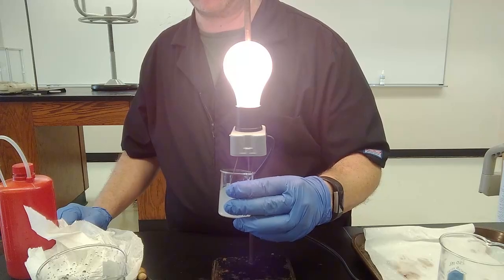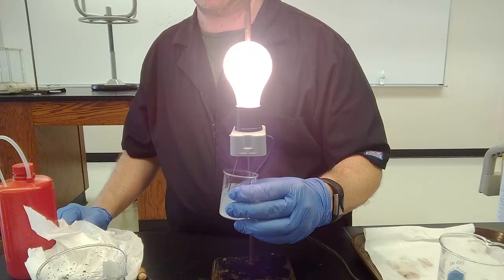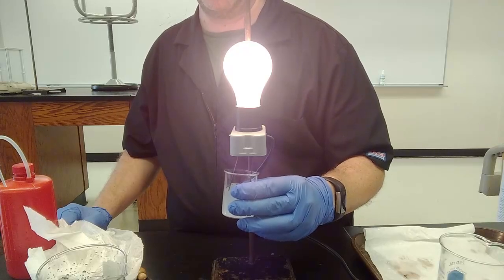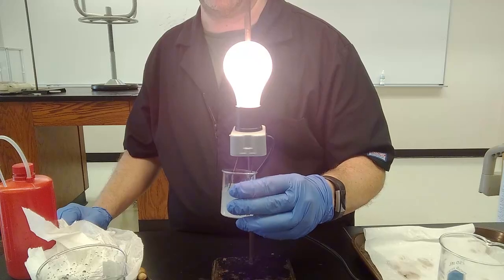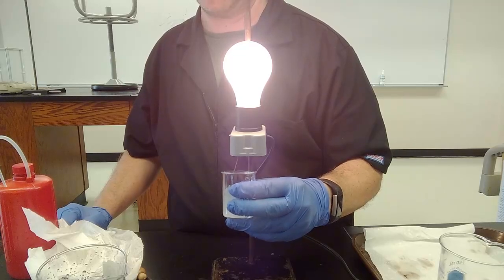Is this metal hydroxide ionic or molecular? Is it an acid, a base, a salt, or none? Does it give us H plus in solution? Does it give us OH minus in solution? Does it give us neither of those but still ions in solution? That's the definition of a salt. Or is it just a molecule that happens to dissolve in water, like sugar? Oops, gave you away the answer for that one, but we already passed it.